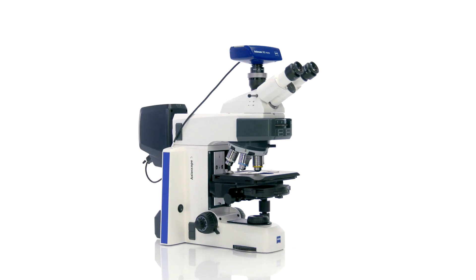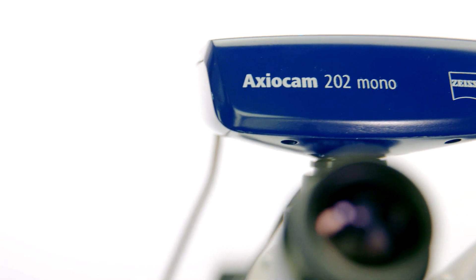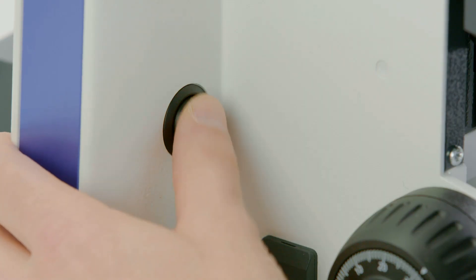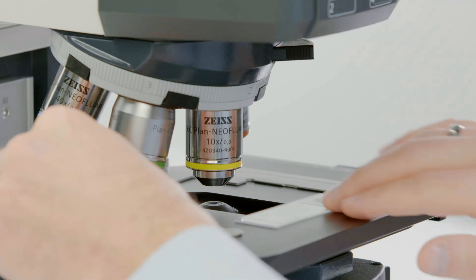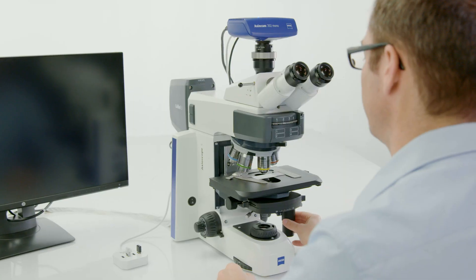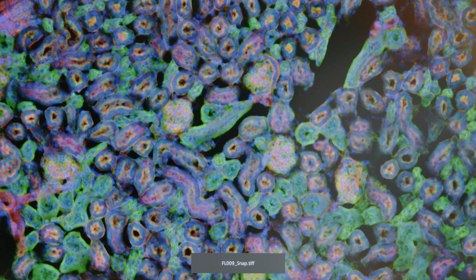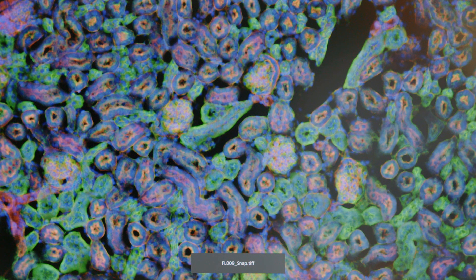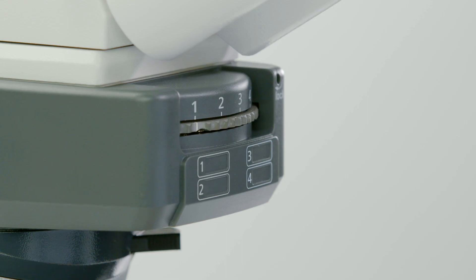Insert a USB flash drive into your smart AxioCam microscope camera, switch on the microscope, and place your sample on the stage. The sample shown is a mouse kidney section stained with DAPI, AF 488, and AF 568.